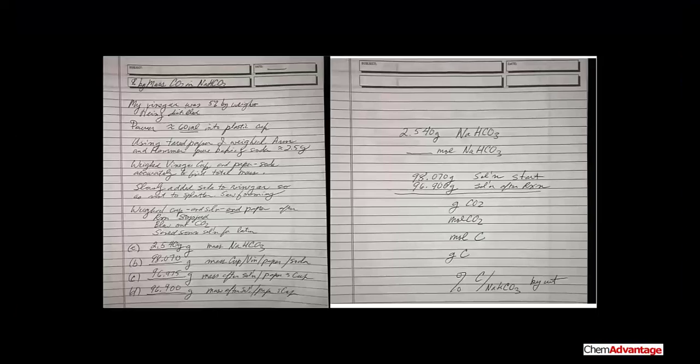Well, here we've just completed the experiment, and you saw how it ran. We got the little fizzies coming in and allowing our carbon dioxide to escape. And now we've got to make some sense of this experiment to see if we could actually find the percent carbon in mass of CO2 and carbon in sodium hydrogen carbonate. Now, a couple of things to look at. Let me get my pen here.